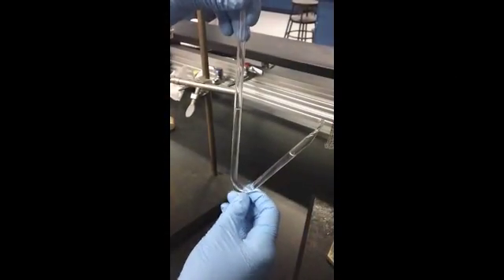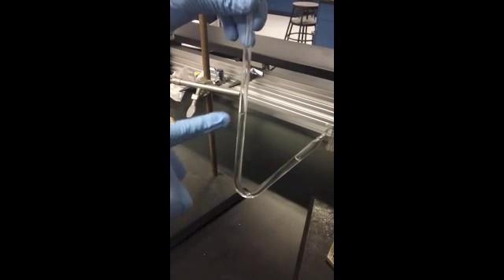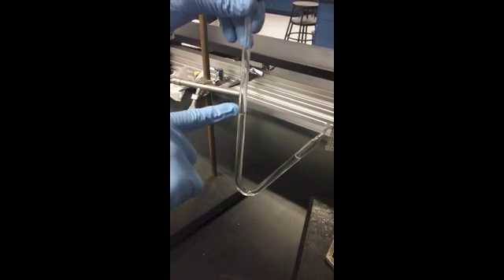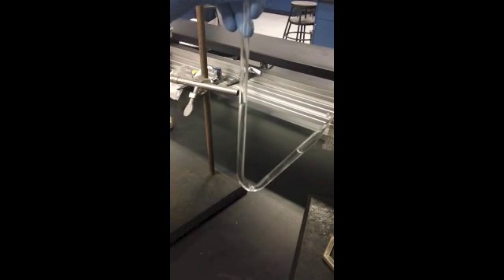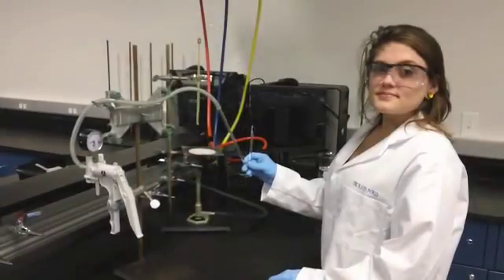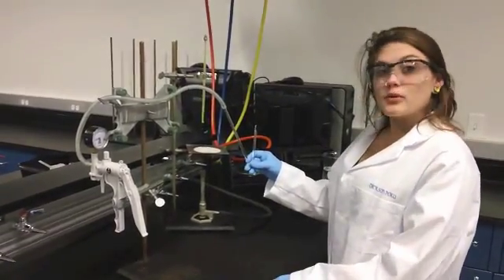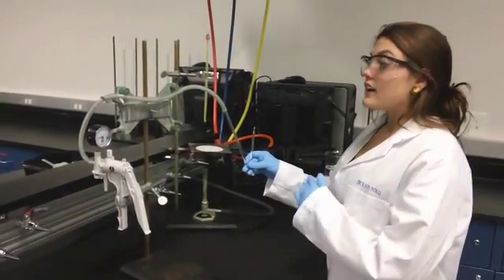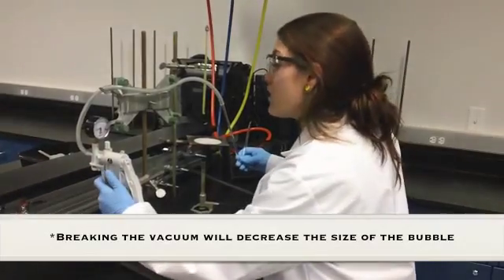For this step, you want to create a bubble whose level is just below that of the level on the open side of the glass tube. You can refer to figure 7.3 for a diagram of this. Once you have a bubble that resembles that of figure 7.3, you're going to break the vacuum in the apparatus by using the release valve on the pump.